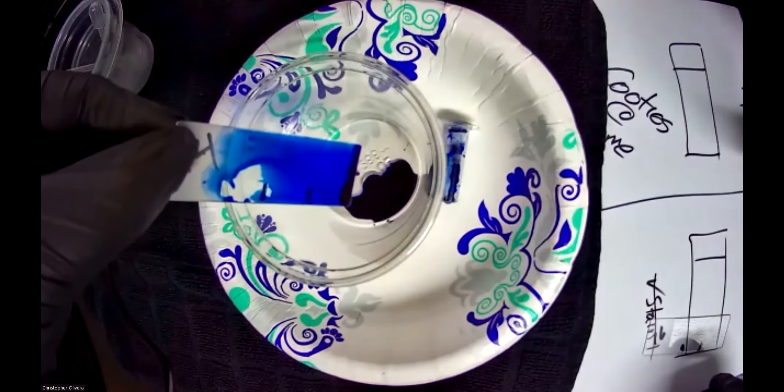Count one minute — I'll discard that applicator so I don't have to worry about it. While waiting one minute, prepare your water. One minute done. Again I'm going to try and hit the number or possibly my thumb to rinse it out — not the actual slide itself. So I'm hitting my thumb, not the slide, nice and rinsed with water. Then we go to step two.